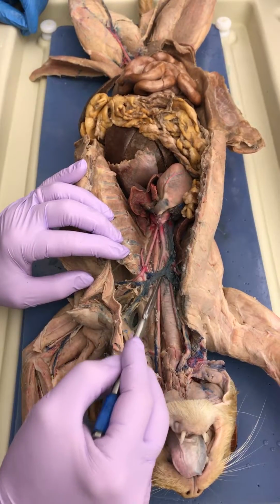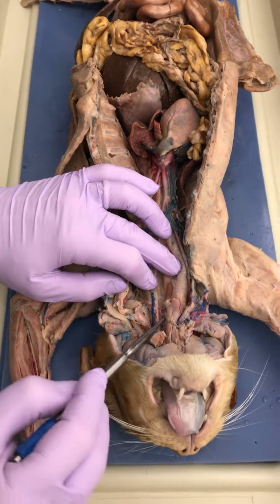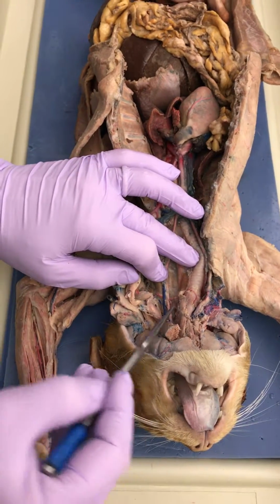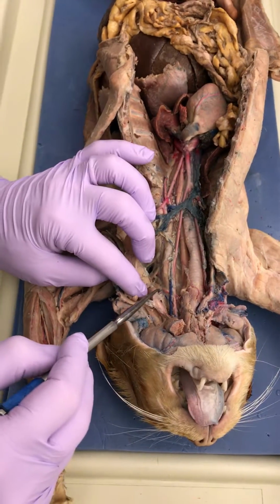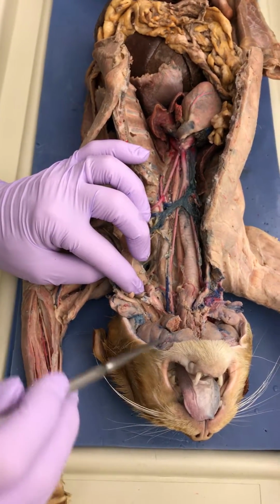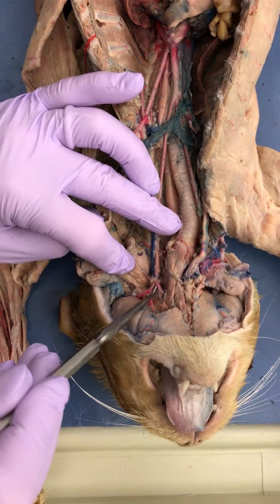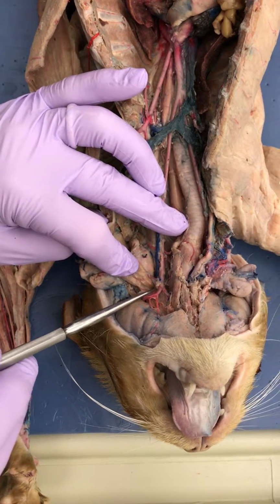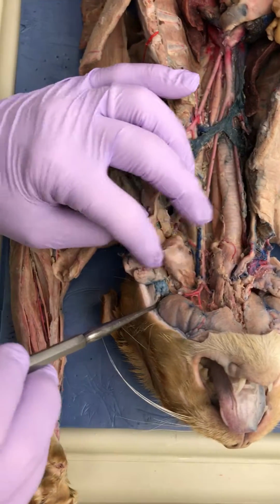Then we're going to follow the left carotid. And, oh, that's good. You still have your superior thyroid artery here, going to the thyroid gland. And you have your muscularis artery here. We'll pull the digastric muscle back. Got a big lingual artery here. Just that real short piece right there is your external carotid, and that should branch.